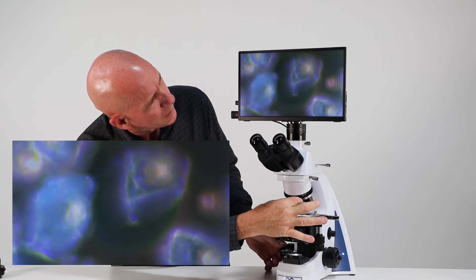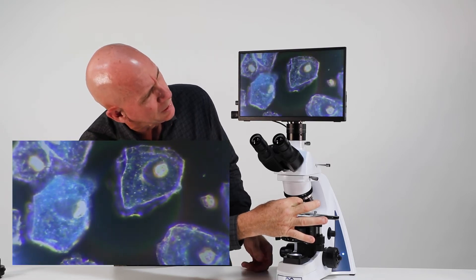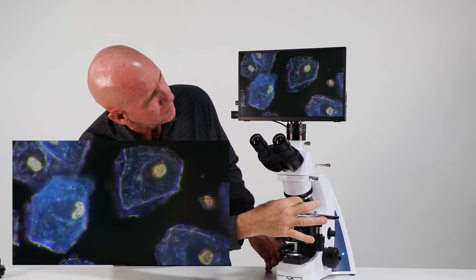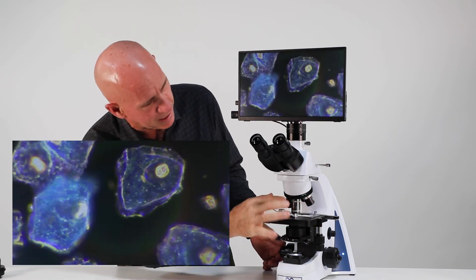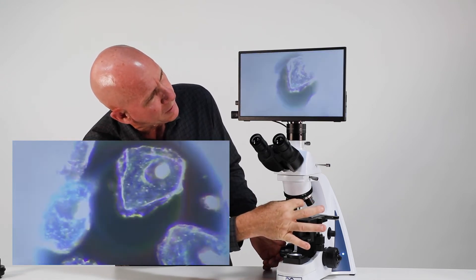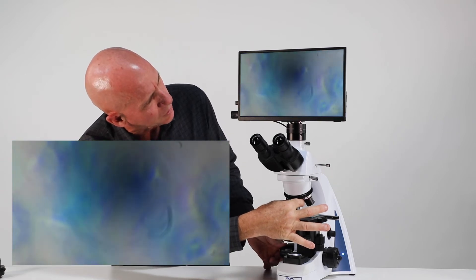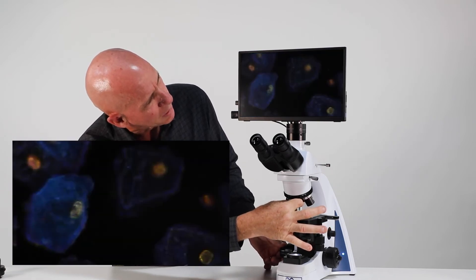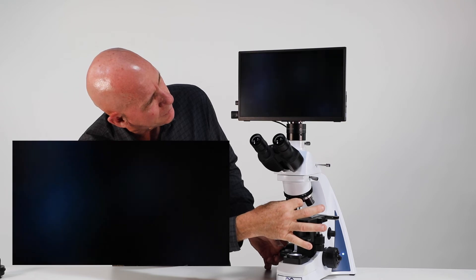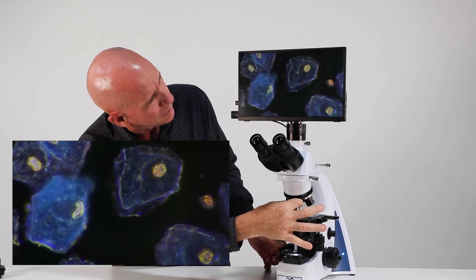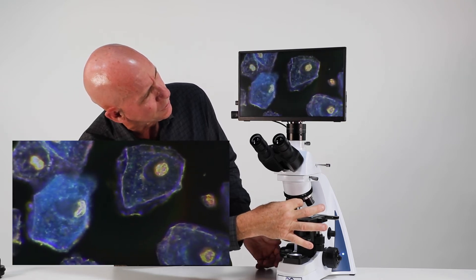Now when I'm closed, I'm in the darkness. So I can play around with this iris. But if I've got it too far open, it's just bright field. So it's kind of washed out.